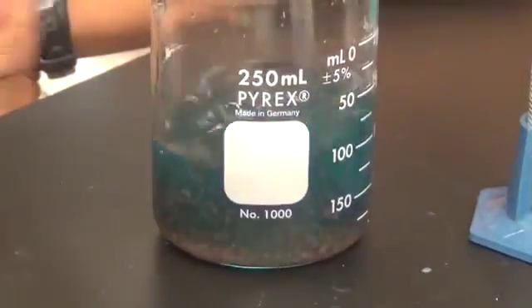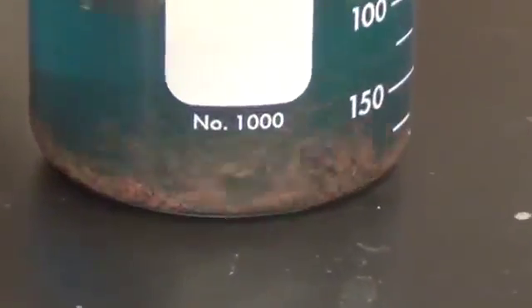Stir Matt, stir. Oh yeah, that definitely looks brown. Oh wow, that's definitely copper.